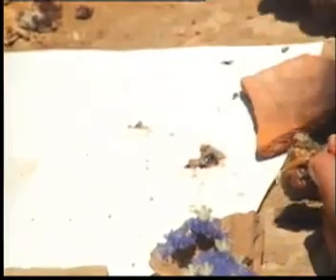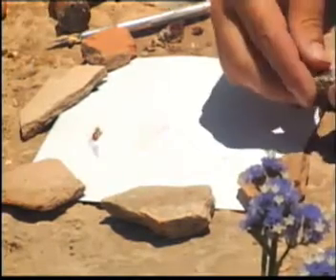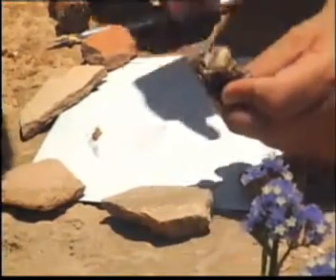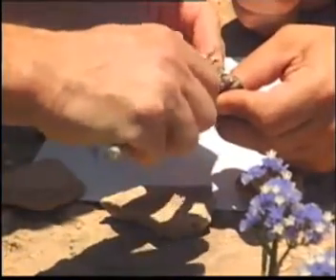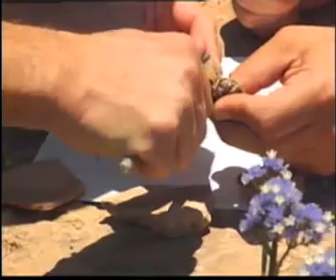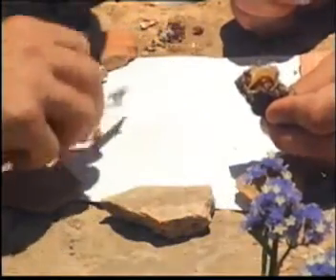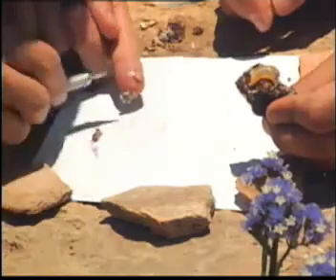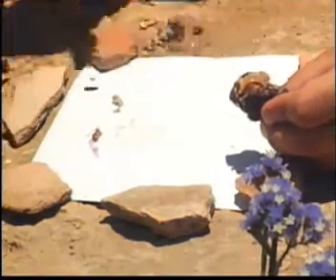That's the whole gland — not the yellow part, just that little bit. We'll do another one. Can you see? That's beautiful — I can see the gland very clearly. This whole area here — let me cut it out. Just put it right down. Nothing's going to happen... well, your fingers will turn blue. There it is, that's the gland. You can already see in a few seconds this is already turning.